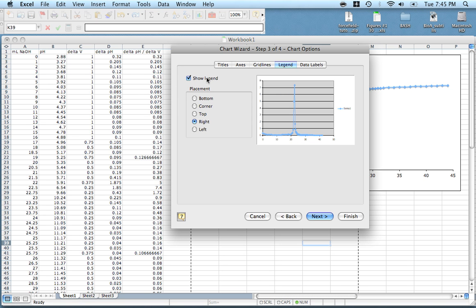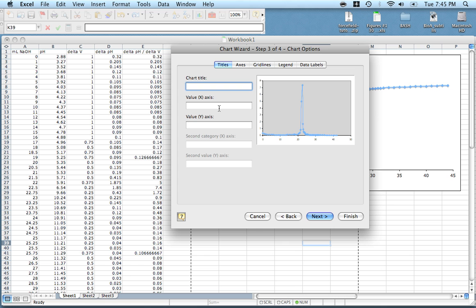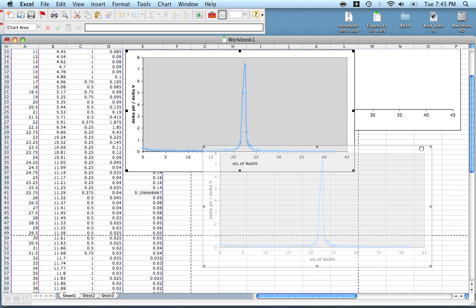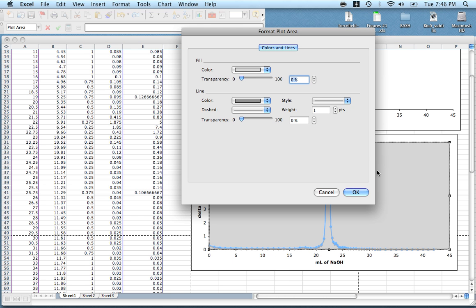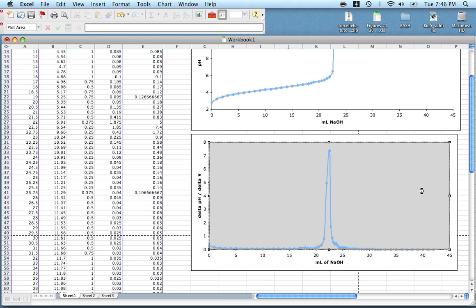We just go through some formatting options. I don't like to show a legend, and I don't like to see grid lines. So the x-axis here is milliliters of NaOH, and the y-axis is delta pH divided by delta V. And there we have it. That looks really good. One thing I like to do is double click anywhere in this area and get rid of this fill, make it no fill, and get rid of this line. That'll save you a lot of ink when you go to print things off.